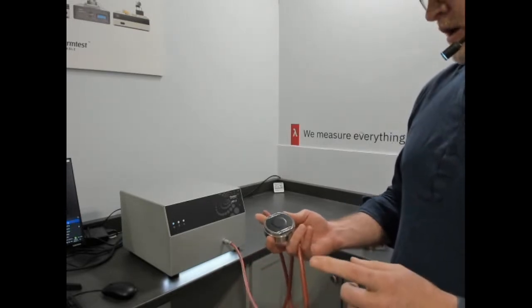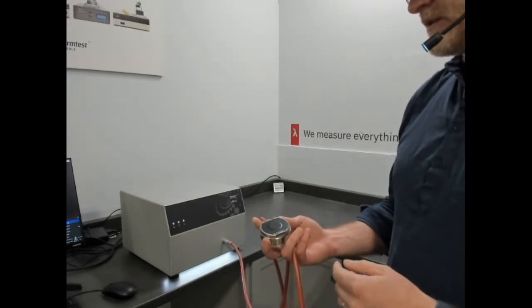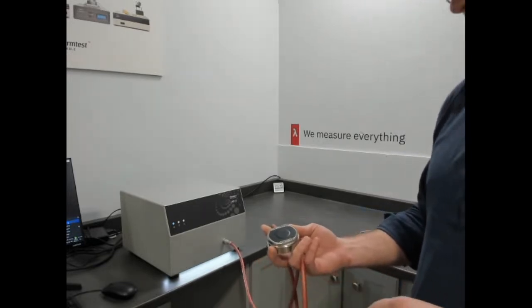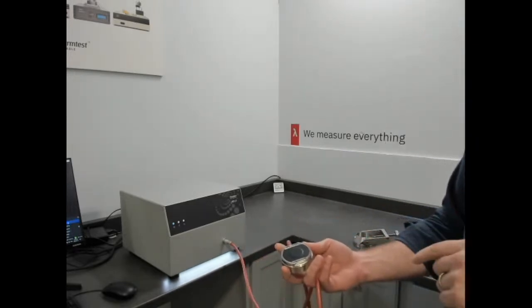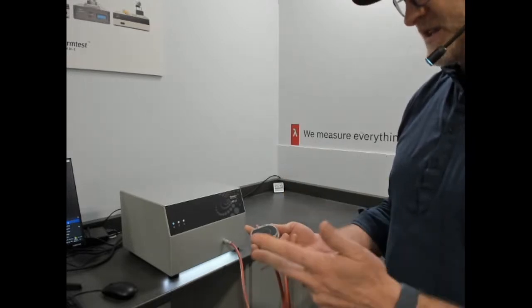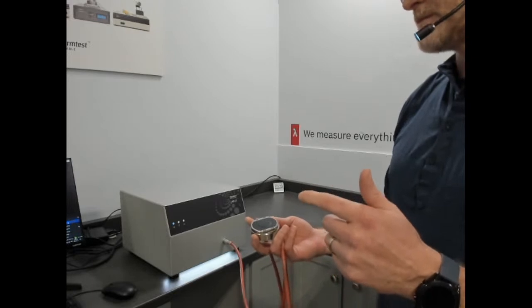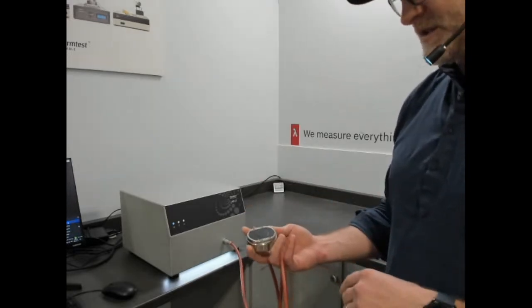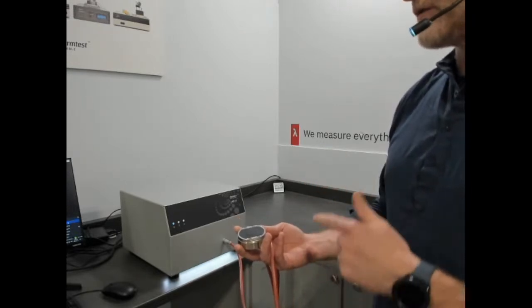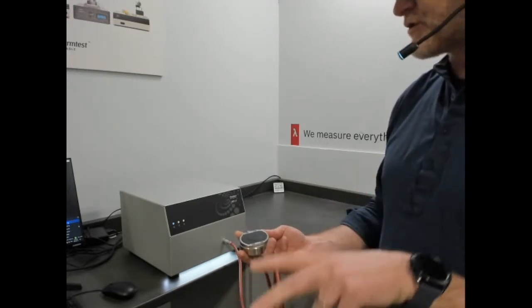What do those ranges mirror? It's fabrics up to around the thermal effusivity of about Pyrex. Pyrex is around 1,000 or 1,100 units of effusivity. So what is effusivity? The proper description of effusivity is the square root of thermal conductivity, density, and specific heat. So that's the mathematical representation of thermal effusivity. It gets a little bit more complicated based off of the way you're measuring thermal effusivity and the shape of your sample and the nature of the sample you're measuring.